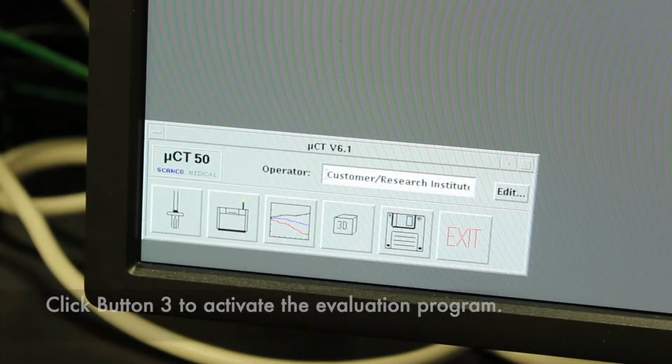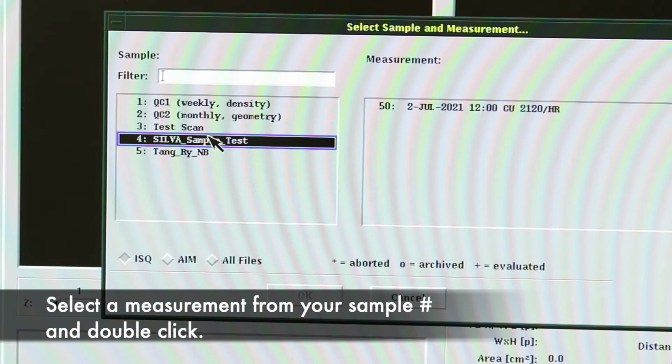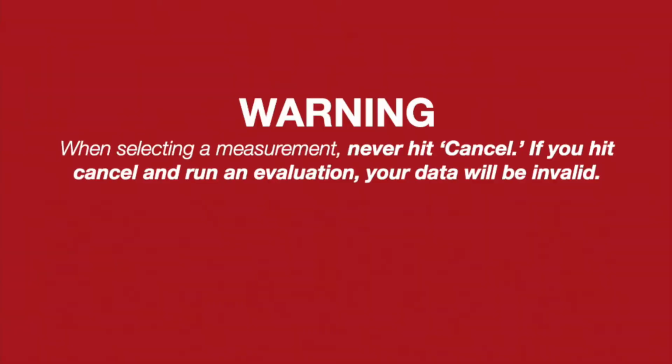To start, click button 3 to activate the evaluation program. Select a measurement from your sample number and double-click. Warning: when selecting a measurement, never hit cancel. If you hit cancel and run an evaluation, your data will be invalid.